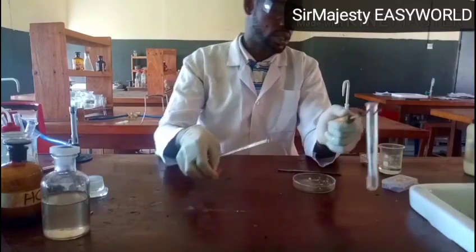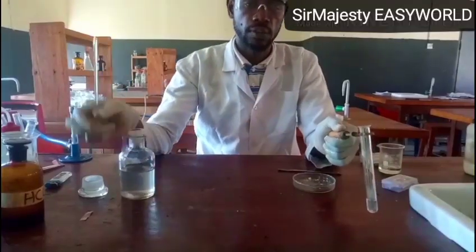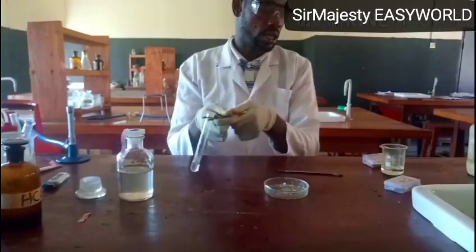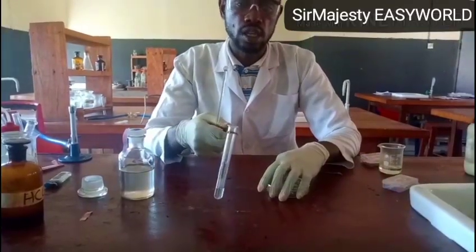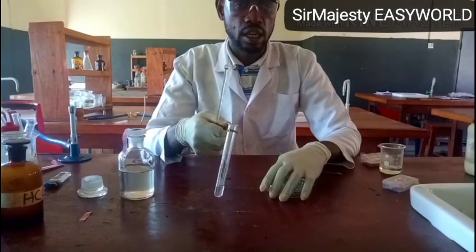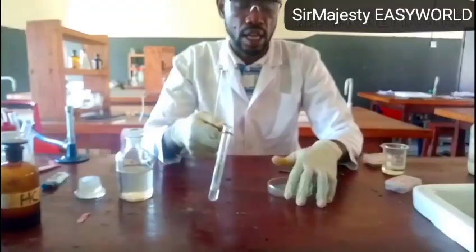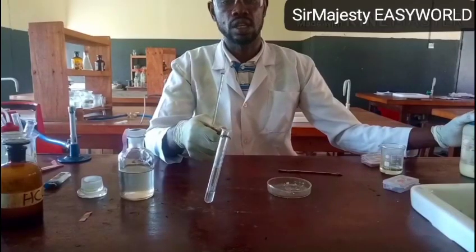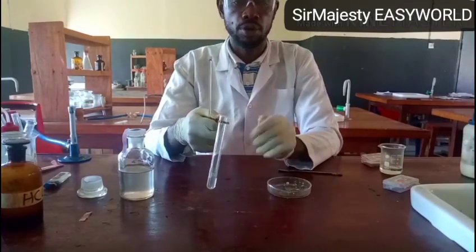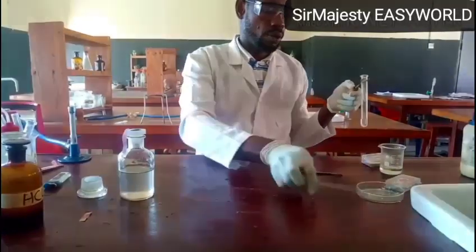When you heat any salt with sodium hydroxide, even potassium hydroxide or calcium hydroxide, if it liberates ammonia, it shows that the salt is an ammonium salt. So what I'm analyzing today, sample C, has proven to contain ammonium ion. Remember, the first test was carried out with dilute HCl, which liberated a colorless, odorless gas that turned lime water milky. This shows that the sample C that we're analyzing also contains CO3 2-. Now, this test also confirmed that it contains ammonium ion. Then we might take another way of analyzing ammonium carbonate.